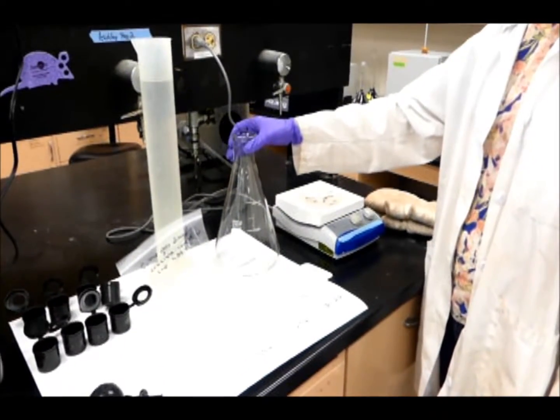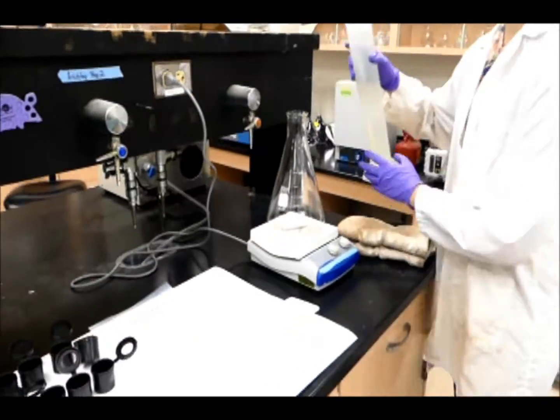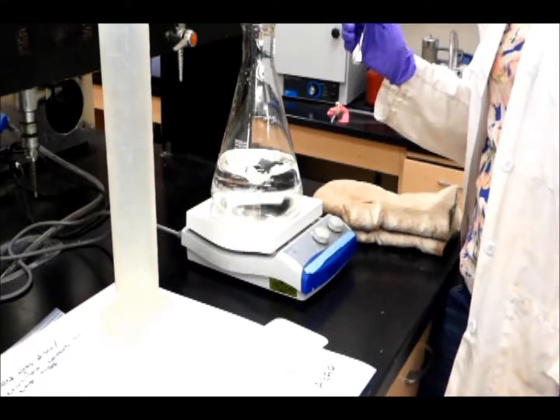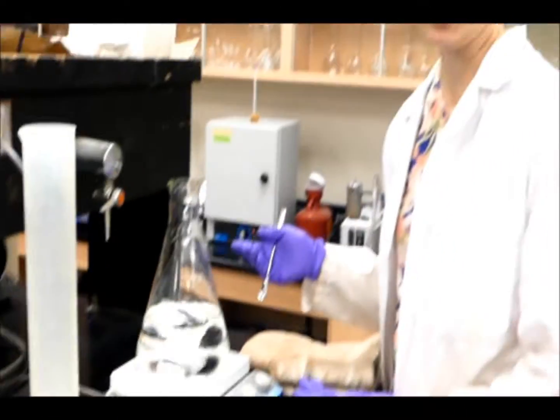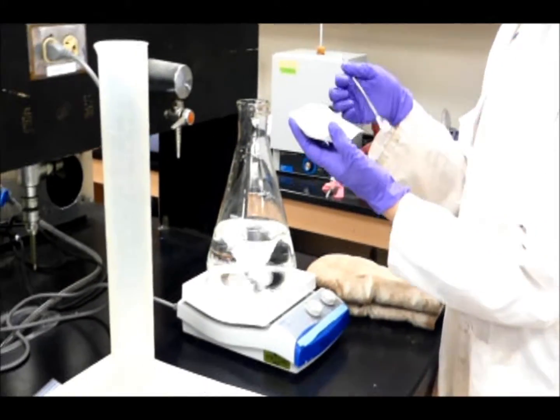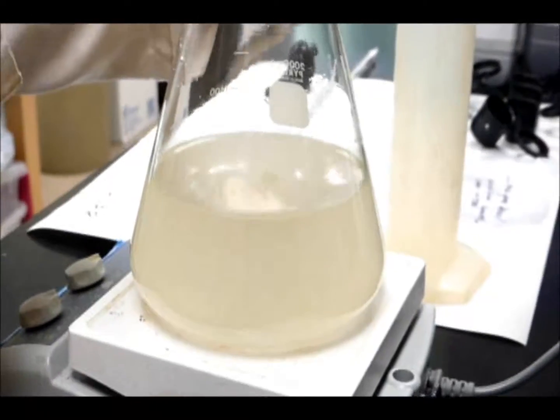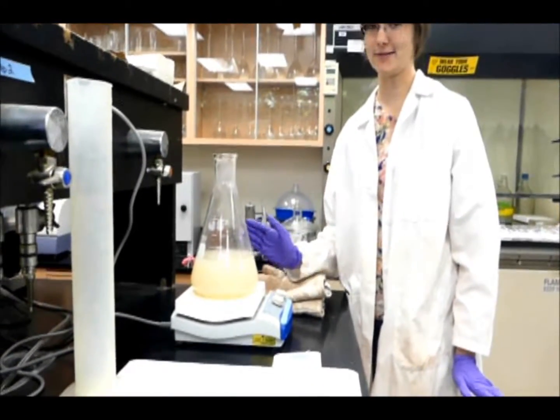So we'll start with adding our water. So I turned on the stir plate and the heat. It's kind of like I'm making a jello. I'm going to add the agar slowly. So we're going to let this boil a little bit. We don't want it to boil too much or it'll bubble out, and that's just a mess.